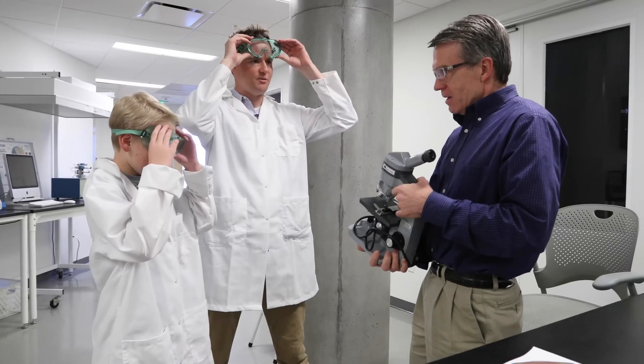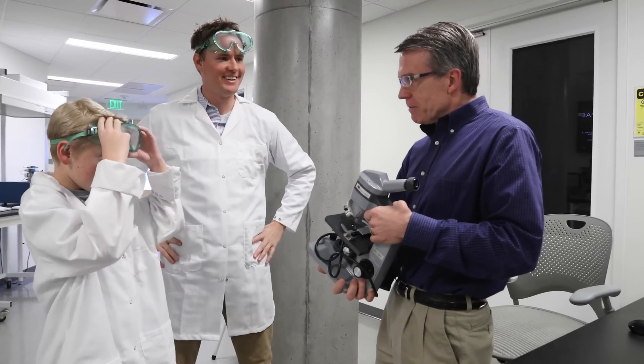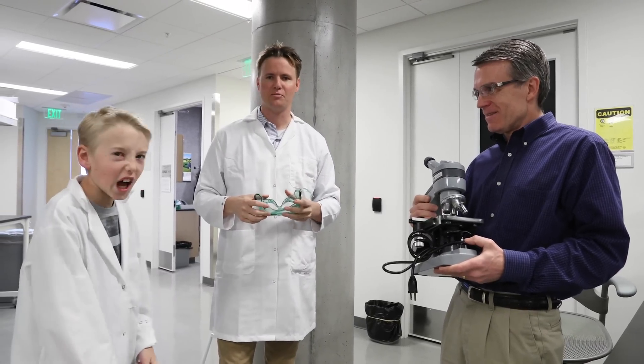Hi, I'm David Bellman. Oh, nice. This is our microscope that we brought. Do we need to be wearing this stuff? Probably not for what we're going to do today. I'm going to keep the lab coat on because I feel cool in it and I feel smarter.